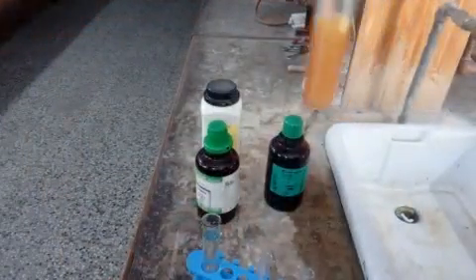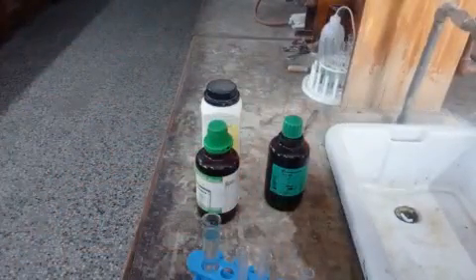I am going to add water. See what happens on mixing the two. Water has formed a separate layer here. This justifies that organic compounds are water insoluble, and they are soluble in substances of the same nature.